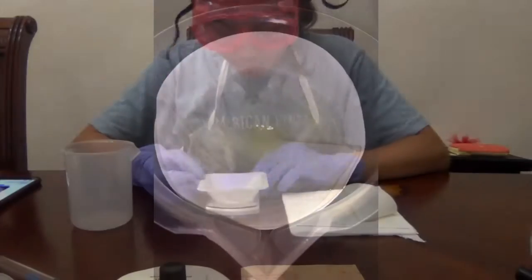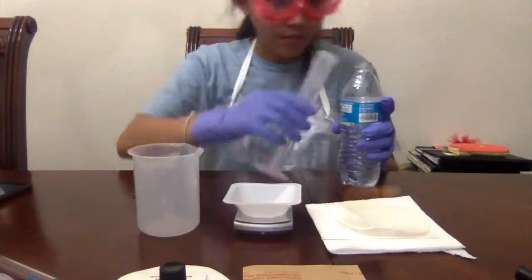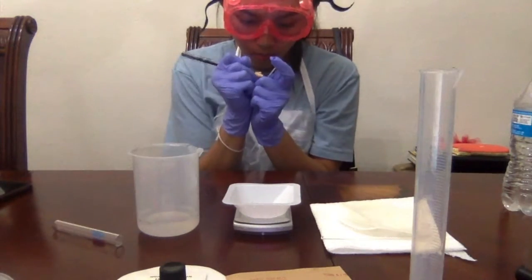For the homemade soap, it had a pH of around 7. Test tube 1 was found to have a foamy bubble layer atop of slightly cloudy waters. Test tube 1 was then mixed with drops of vegetable oil. Here, the foamy layer was still apparent, but the water was much cloudier and foggy in appearance.